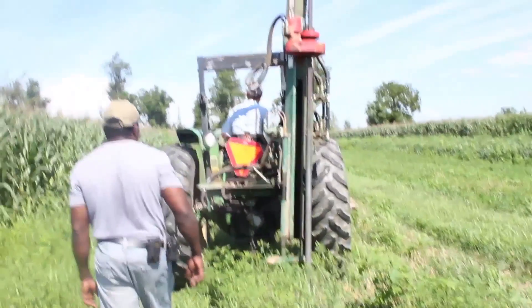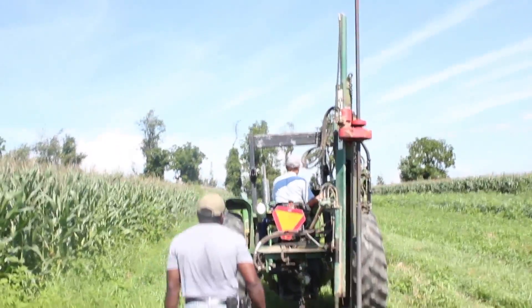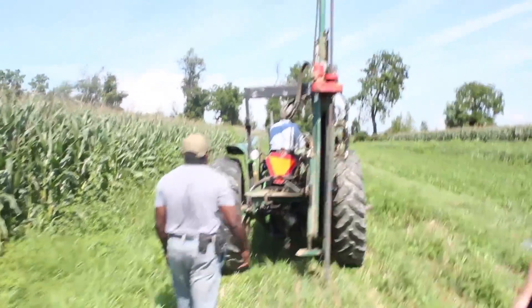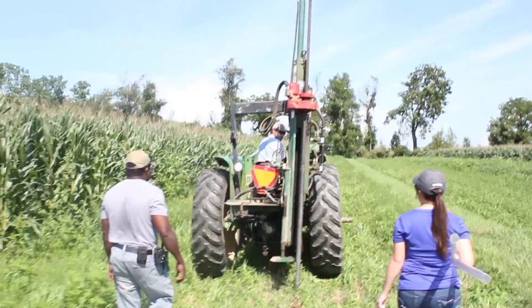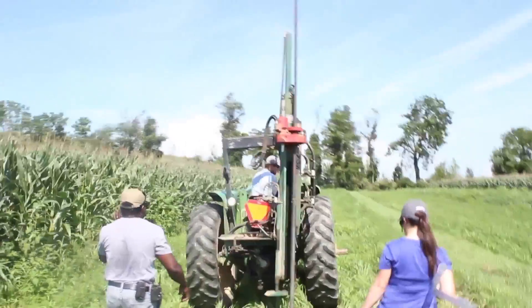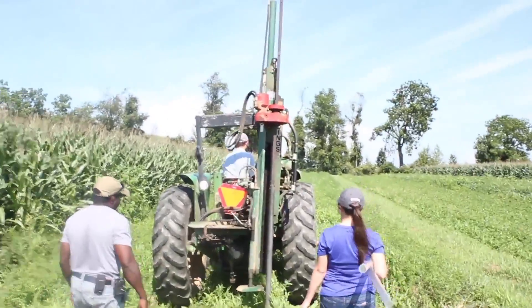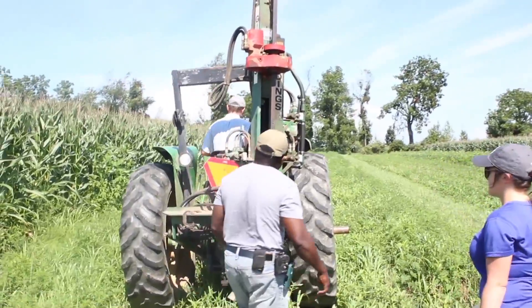In this video, you will see our research team collect soil cores using a Giddings soil probe. Rick, a member of the research team, will drive the tractor out into the middle of the plot to find a spot where he can collect the soil.